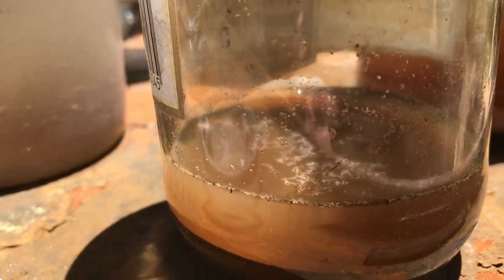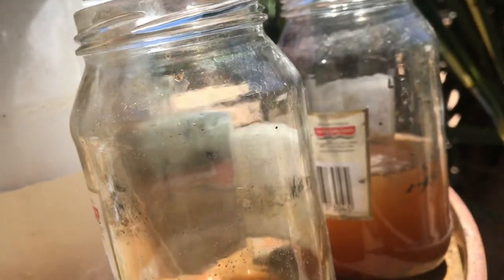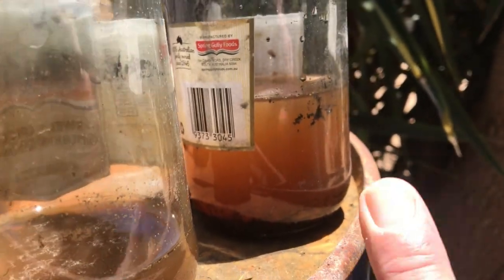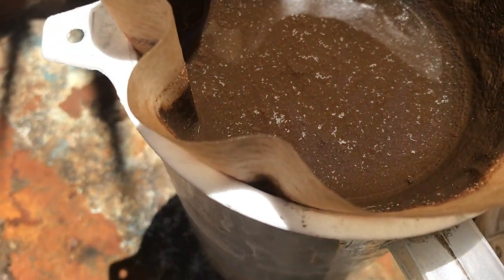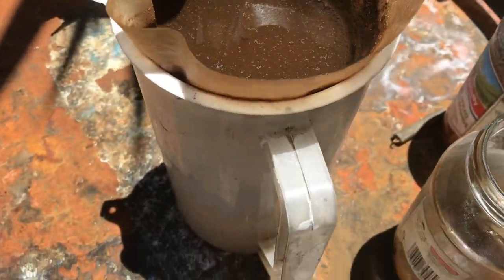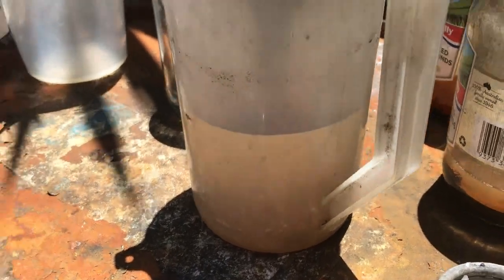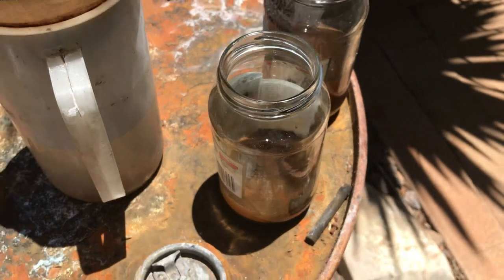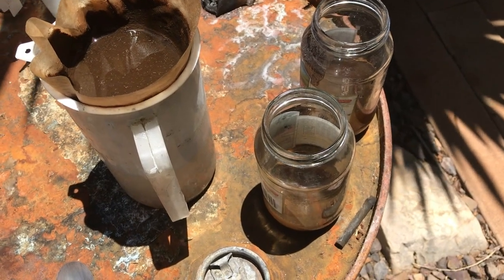You can see stuff floating on the top — this is about 15 to 20% graphite content. That was the more refined version; this was the heavier rock version where I just chucked the whole rocks in without crushing them. I've got it in the filter — there's graphite or possibly graphene floating on the top. The sieve isn't doing too bad a job, though it's a bit murky. It's still taking 100 grams of bicarbonate soda to neutralize 20 ml of the acid. For the next experiment I'll reduce the acid a bit more — three more times — and see if we get exfoliation.